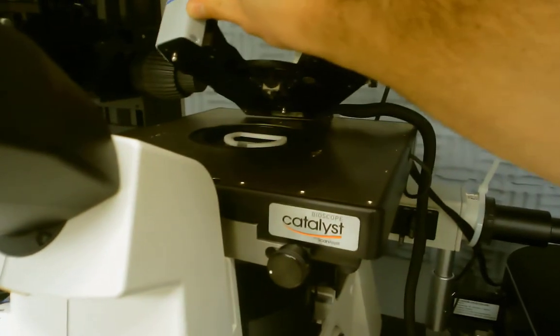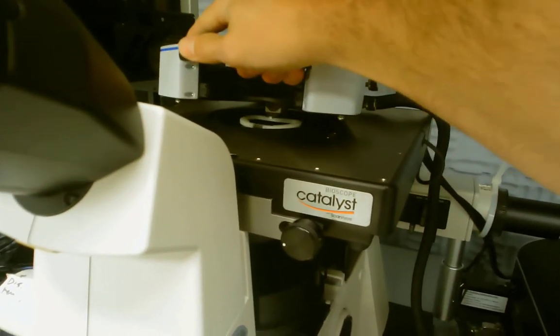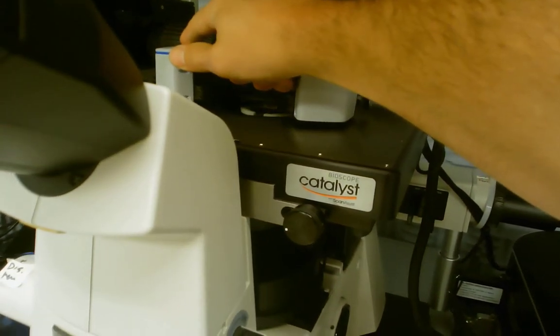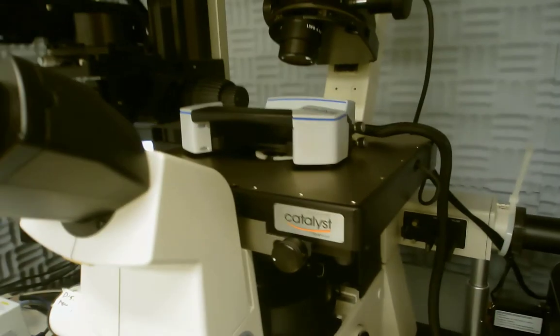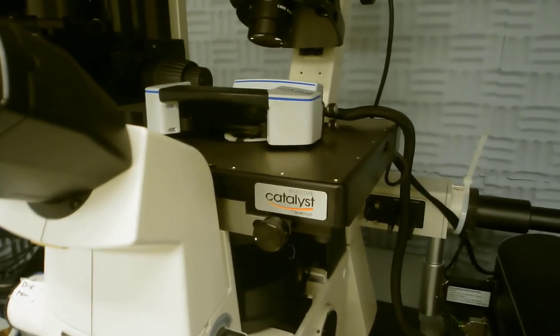And then the cradle is placed over the top of your sample carefully. There are a couple different pegs. There are three different pegs underneath each corner which go into tiny slots on the base plate and hold the cradle in place.